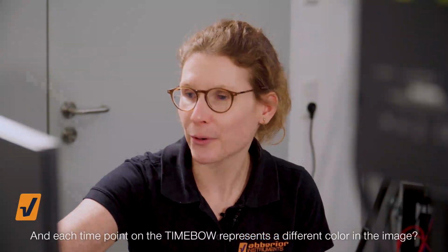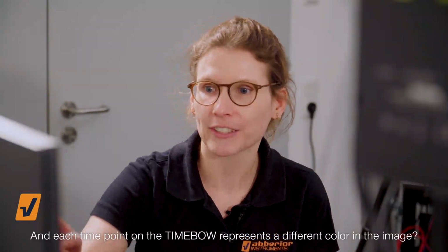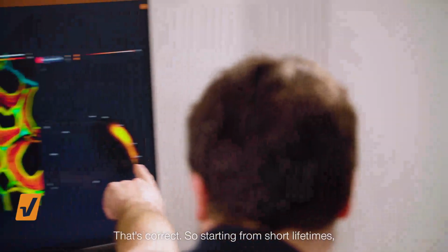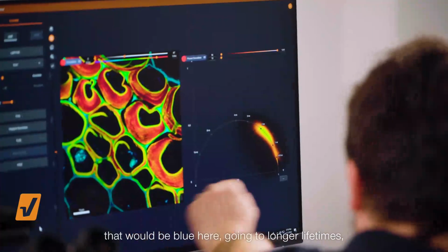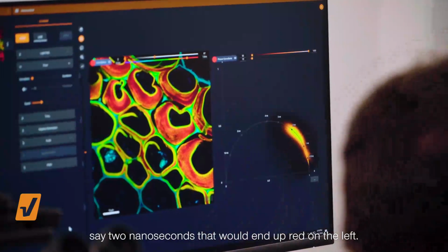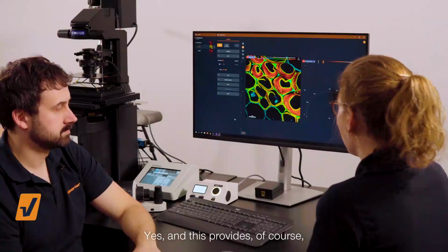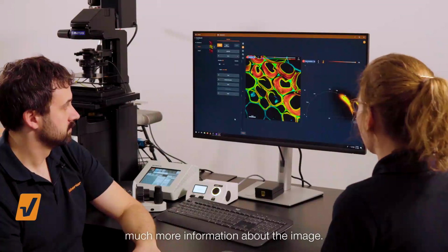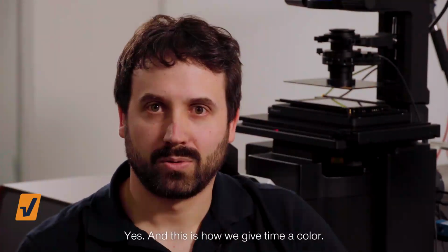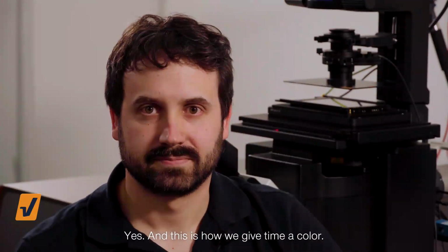And each time point on the TIMEBOW represents a different color in the image? That's correct. So starting from short lifetimes, that would be blue here. Going to longer lifetimes, say 2 nanoseconds, that would end up red on the left. Yes, and this provides, of course, much more information about the image. Yes, and this is how we give time a color.